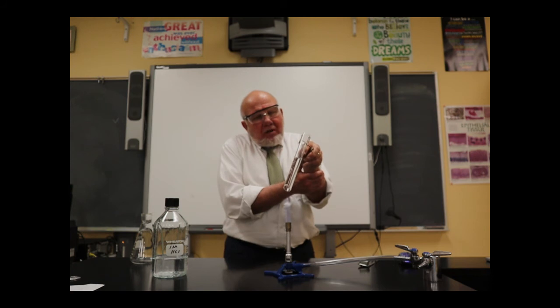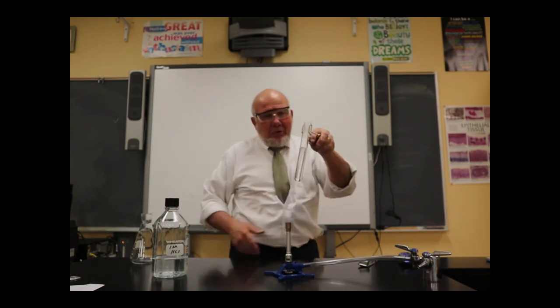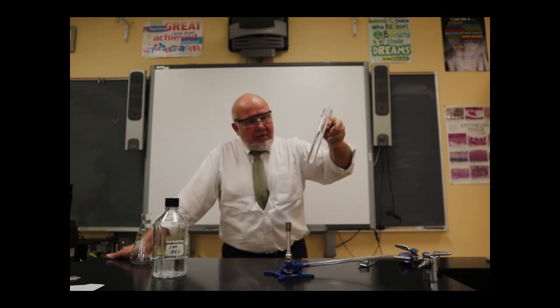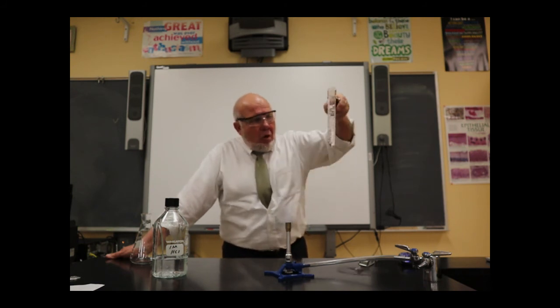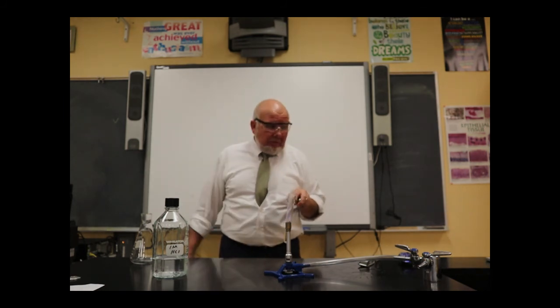be more likely that it might splash out. Now I'm holding my hand because it's actually getting pretty tiring, pulling my shoulder like this. And oh! And that is what we have to be careful of.